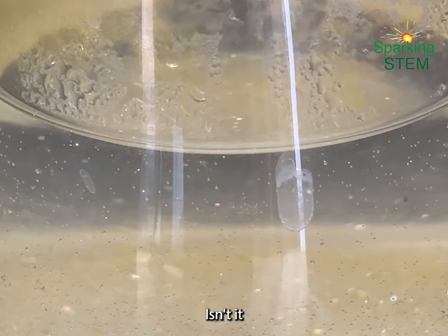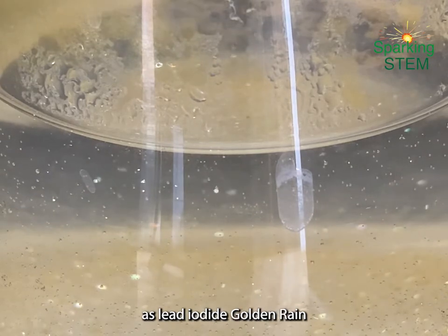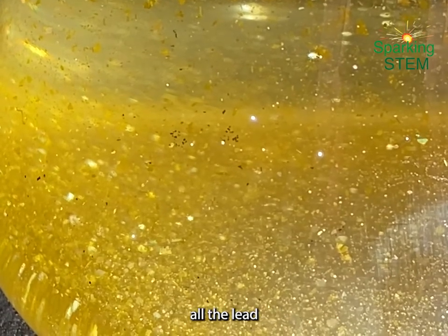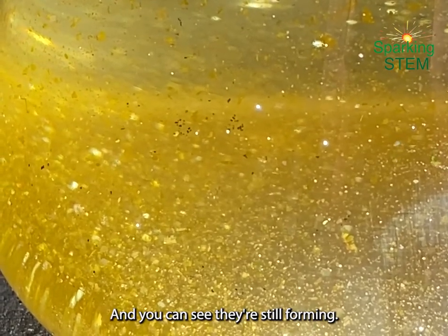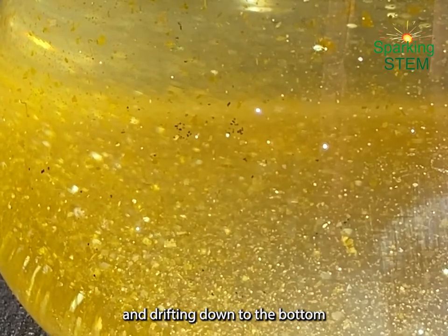Now, it takes quite a few hours for this to cool down enough to get what you'll see at the end, but look at it, isn't it beautiful as they shimmer down and fall as our lead iodide golden rain. And this is what we end up with several hours later. All the lead iodide crystals have dropped to the bottom of our conical flask, and you can see they're still forming, they're still falling out of solution here and drifting down to the bottom.